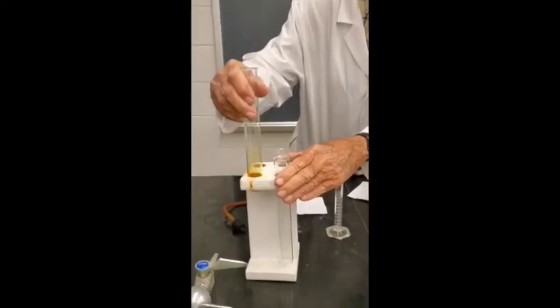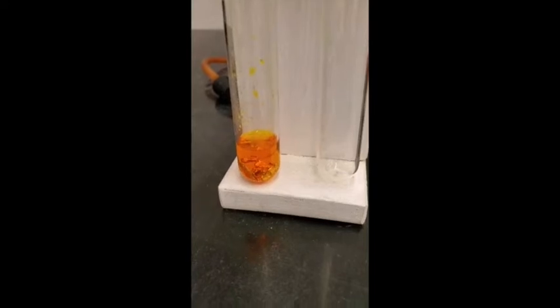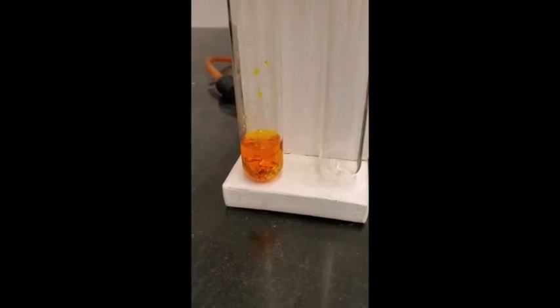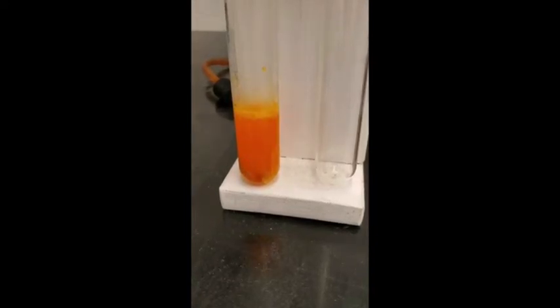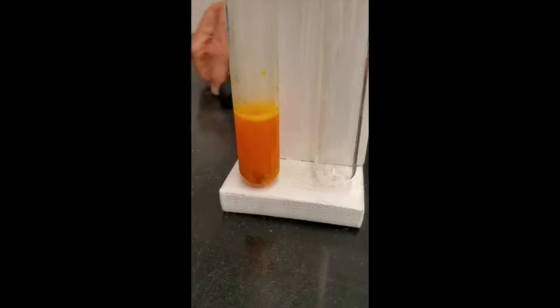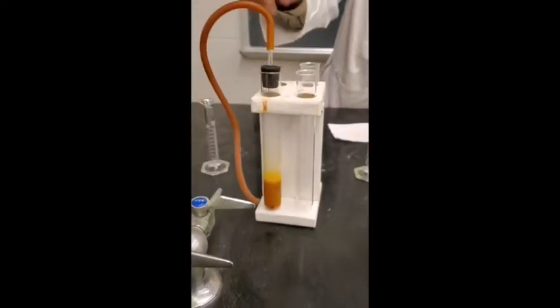And then we'll add hydrochloric acid, and that'll start reacting with the zinc. And that'll activate the surface of the zinc to reduce the chromium 6 to chromium 3. See if there's any evidence of reaction here. See any evidence of reaction? Yep, it's reacting with the zinc. And it's making hydrogen gas. And I'm going to put this on there and direct the hydrogen gas off to the side there.